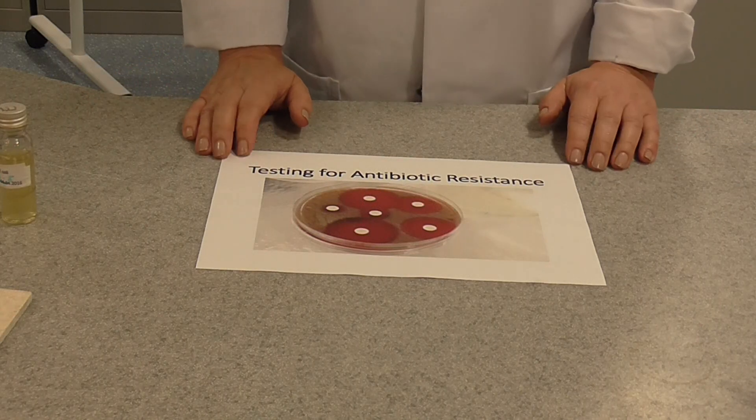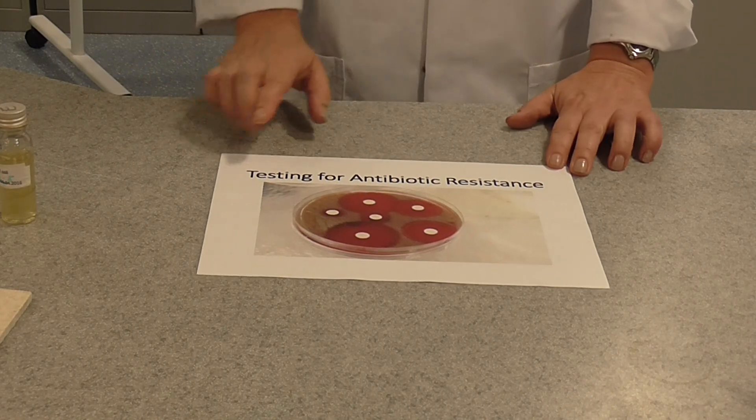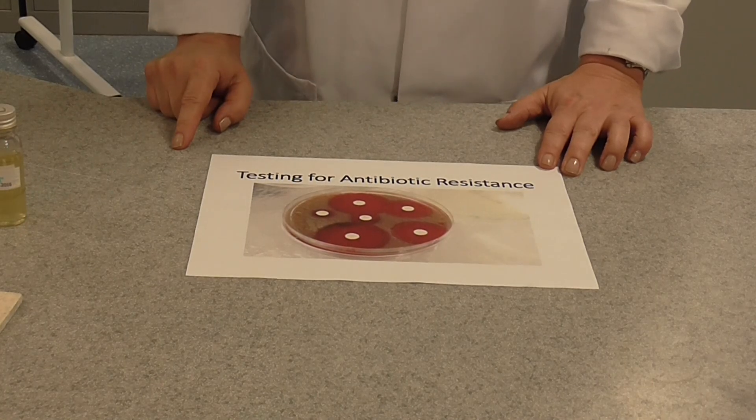Today I'm going to show you how to do one of the A-level required practicals, which is testing for antibiotic resistance in bacteria.